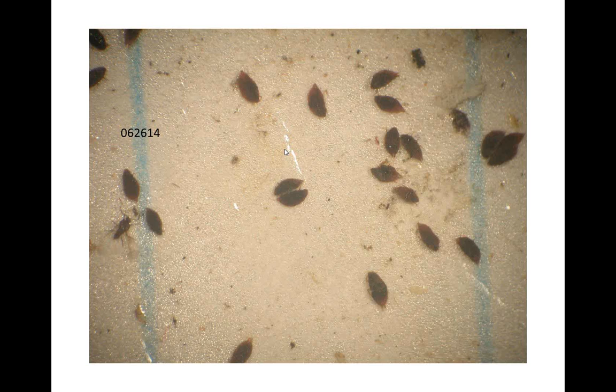Well, Mike, even if we don't have to separate the 2 counts, can we count the big ones first, put down the number on the Excel spreadsheet, and then start to count the smaller ones? And like you said, the sizes here are very different. John, did you see any nymphs, any immatures, where the size was between these 2, where it was hard to judge?